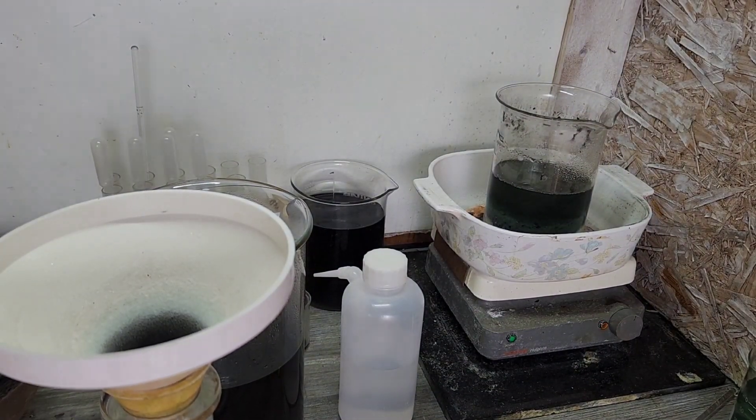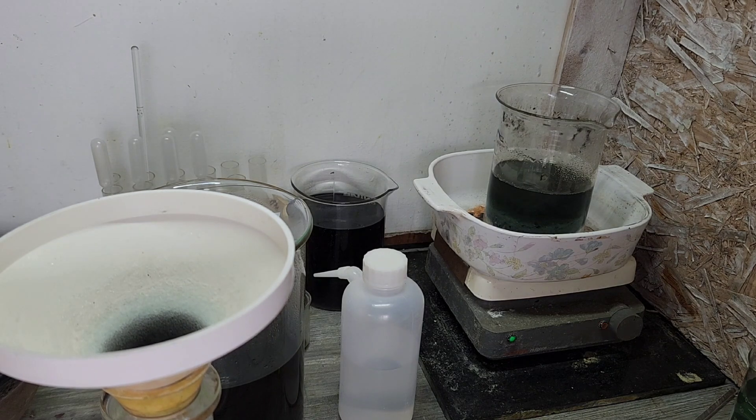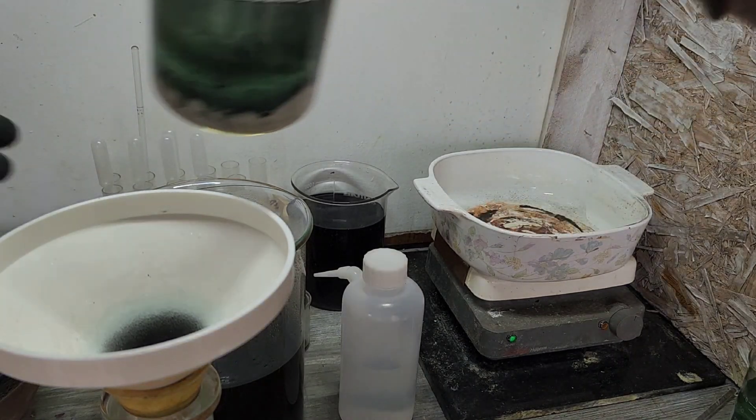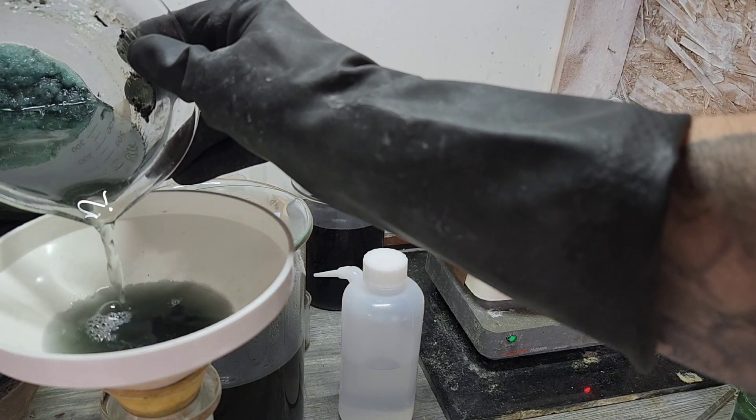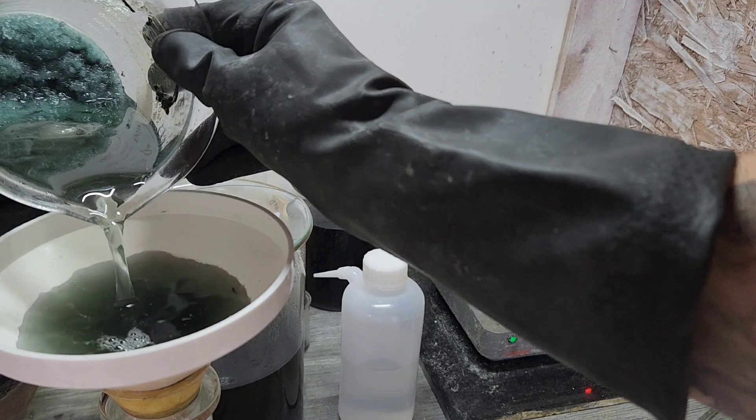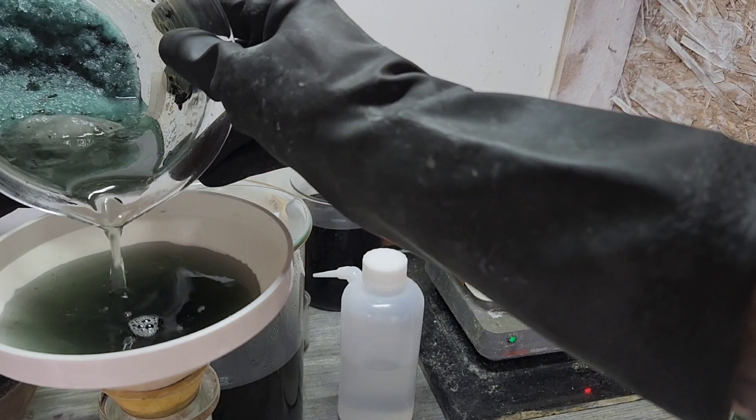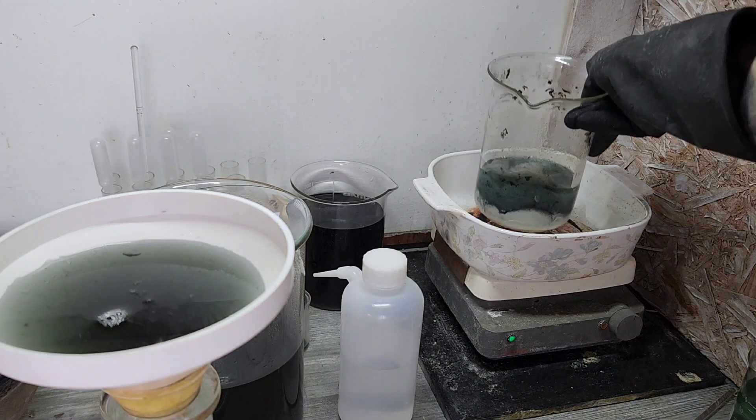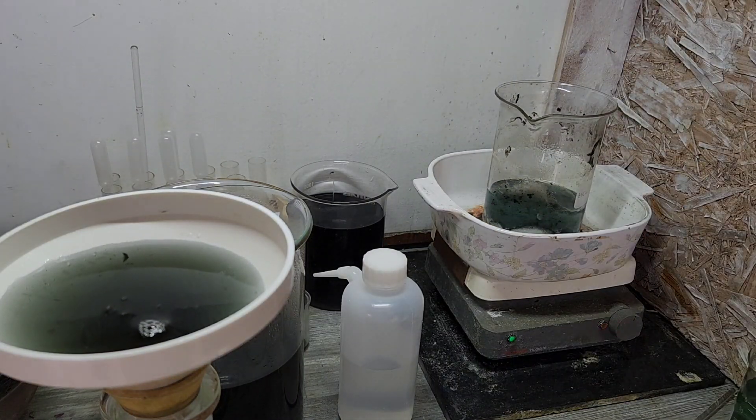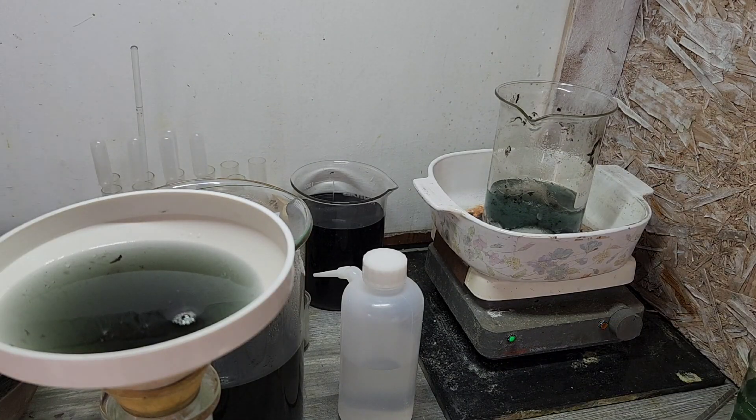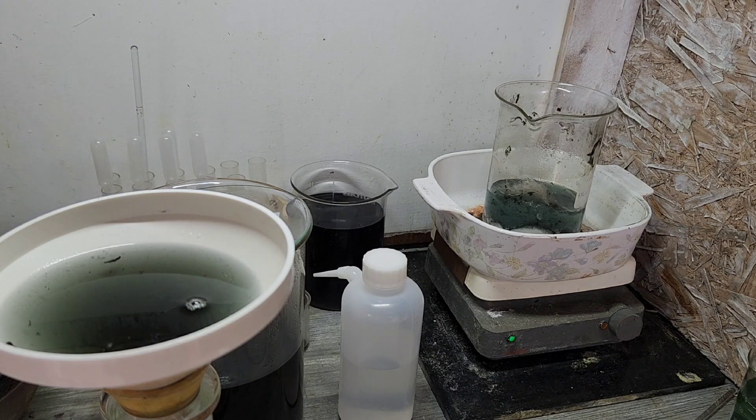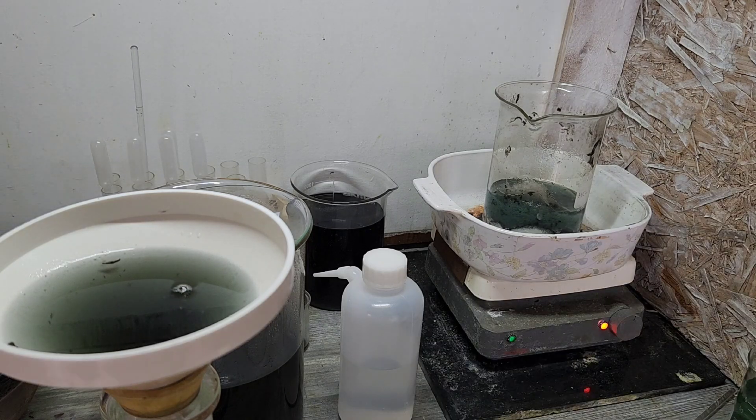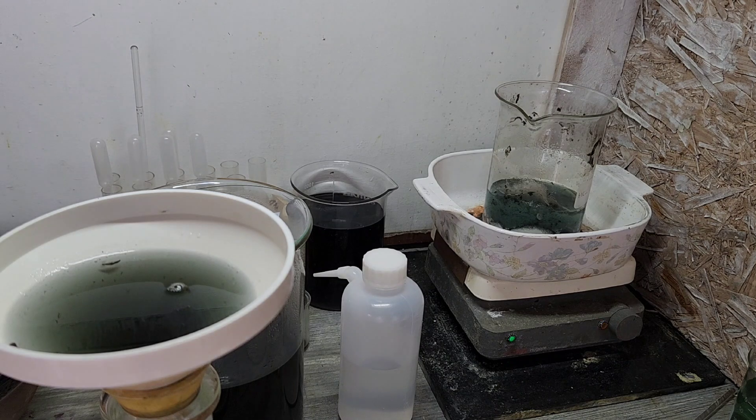All right, so I've had some distilled water on the heat and it is time to get some more of these crystals here. What I'd like to do after the crystals come crashing out of solution in the beaker that I have outside, I'd love to re-put it back in here and absorb it and basically just keep this process going. And we should be able to create quite a bit of ferrous sulfate crystals that are highly pure and filtered nice and clean. So we should have a beautiful gold drop off of this. I'm actually really excited.